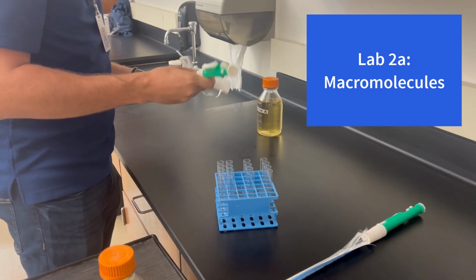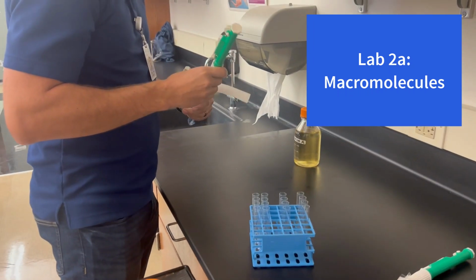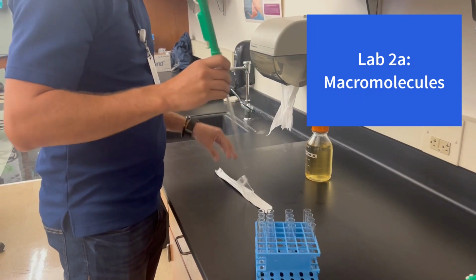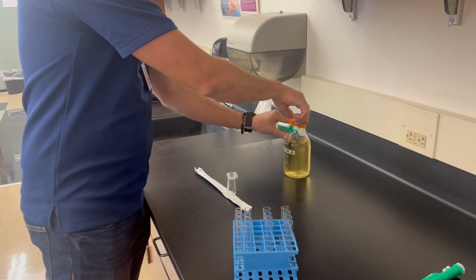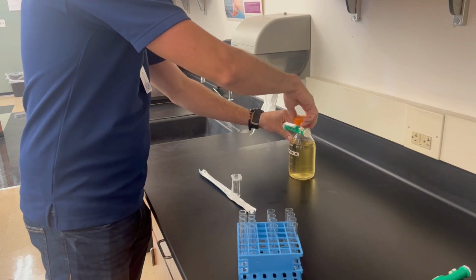Welcome back. Today we're going to be watching Brian do the Macromolecules lab. If you are an online student, go ahead and watch him as you would your lab partner. Then you can use his results to fill out the lab.